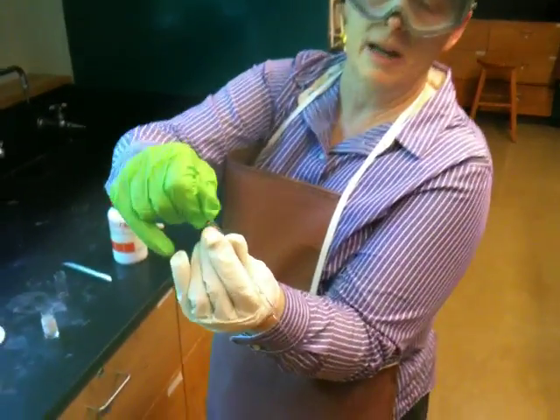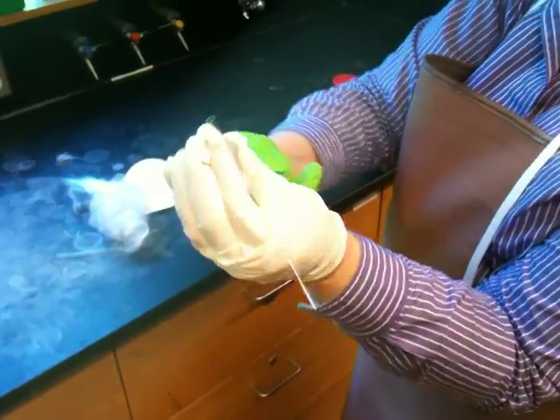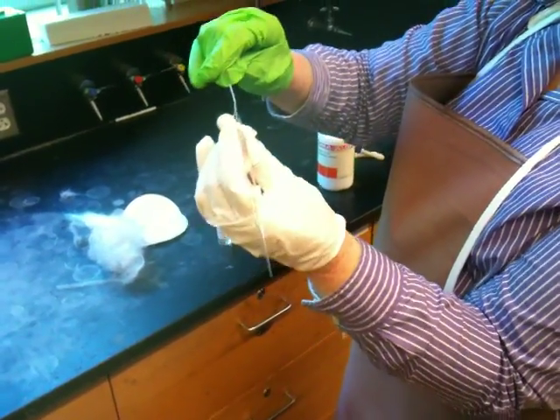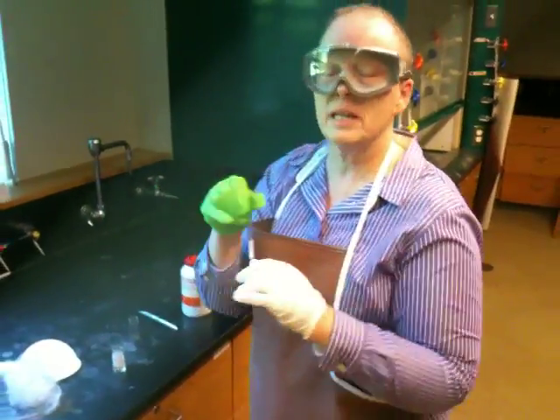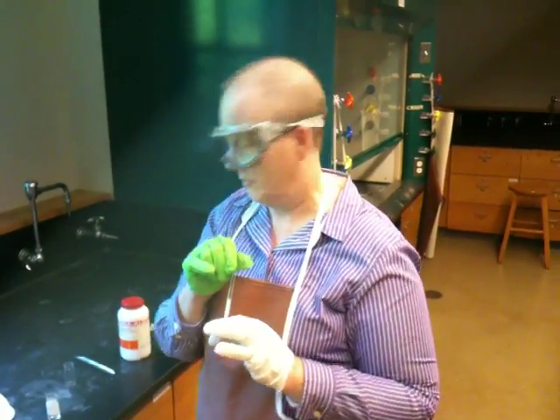And anyone who's done chromatography, and I won't be able to do it, of course. Let's see what happens here. I'm having problems. But, you know, everybody has problems on some days. There we go, got it in. Okay, it's almost like you're making a little chromatography column if you've ever done that.